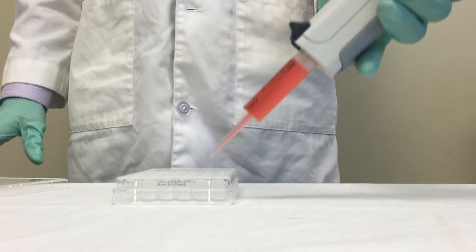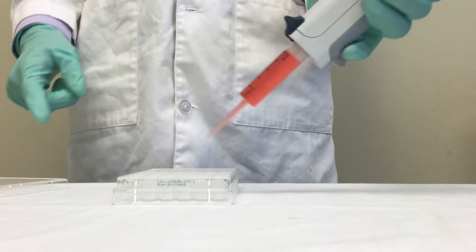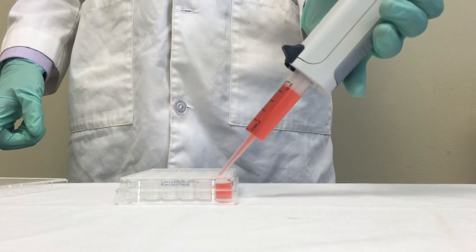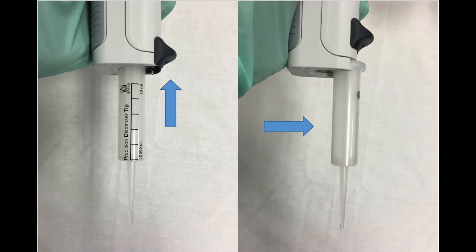Click the control key each time you want to dispense your desired amount. To eject the tip, push up on the mechanism and slide the tip to the side. It should come out fairly easily.